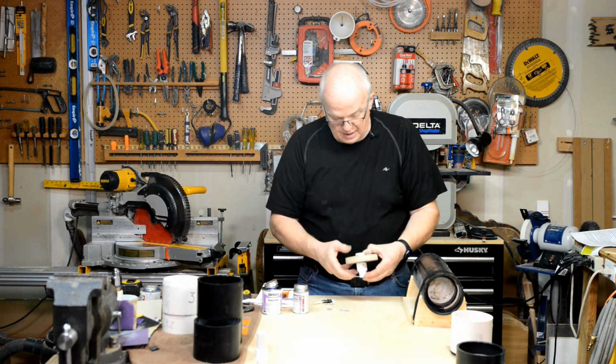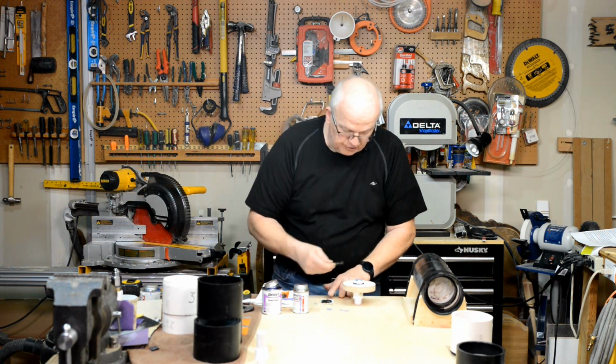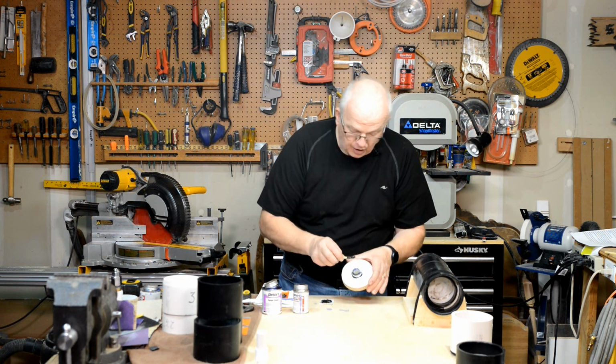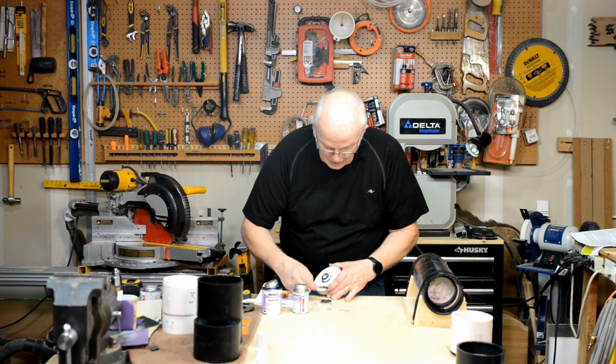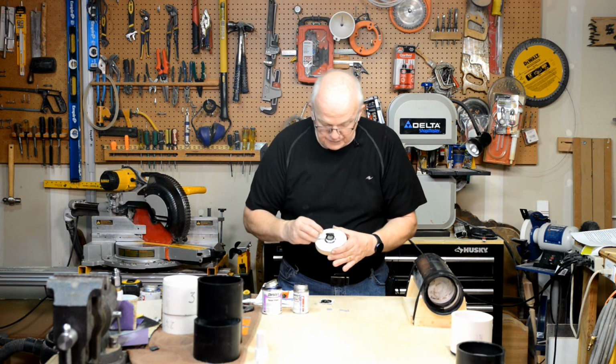Okay? And then one last thing. Take a little bit of your epoxy and put a thick layer of it around this outside edge here on the top, where you can see those two pieces of PVC coming together. Okay, if you do that, you can virtually assure yourself that you're not going to have a leak.